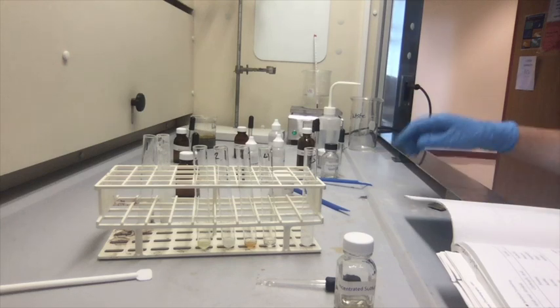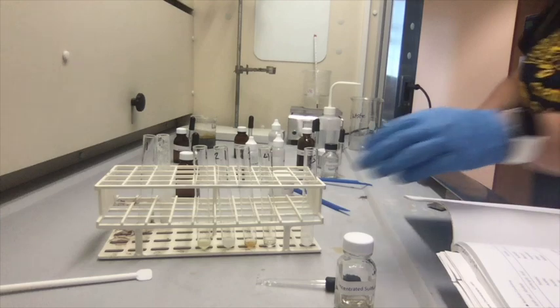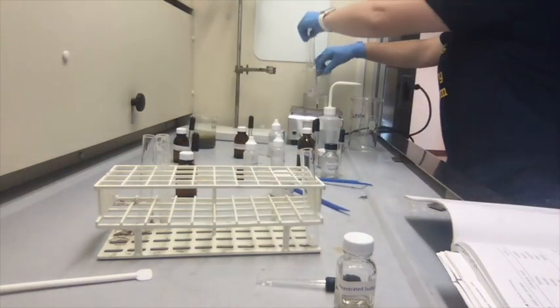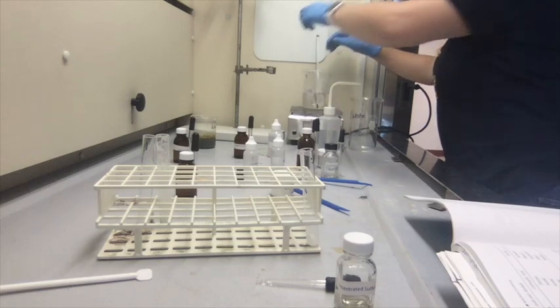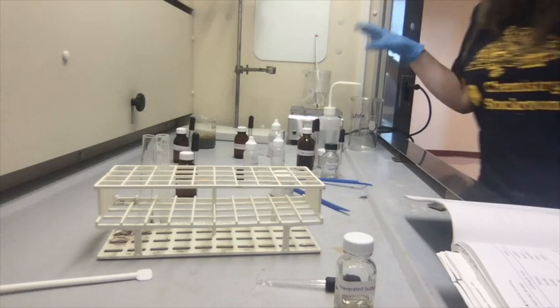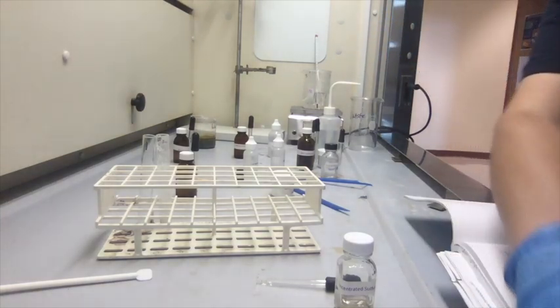So I'm going to go ahead and place these into the hot water bath. And I'm going to let that heat up for 15 minutes.